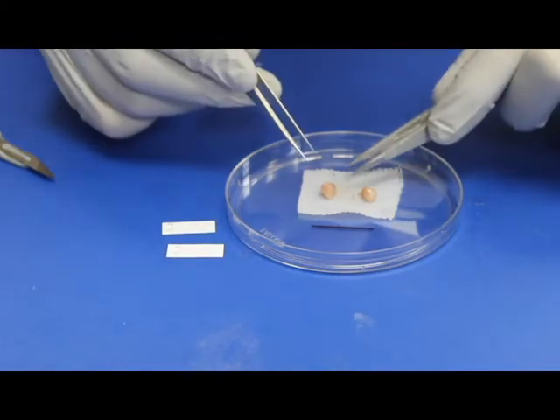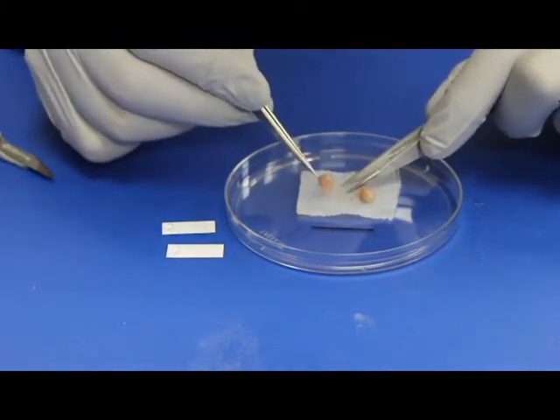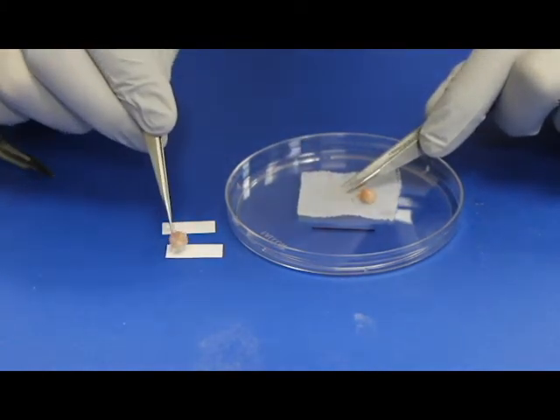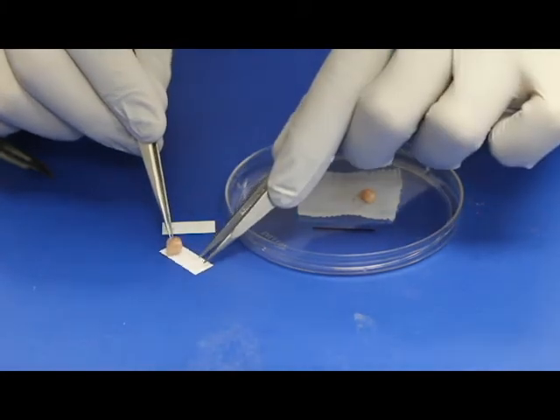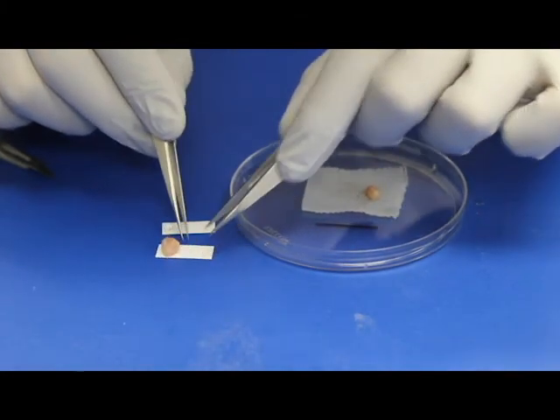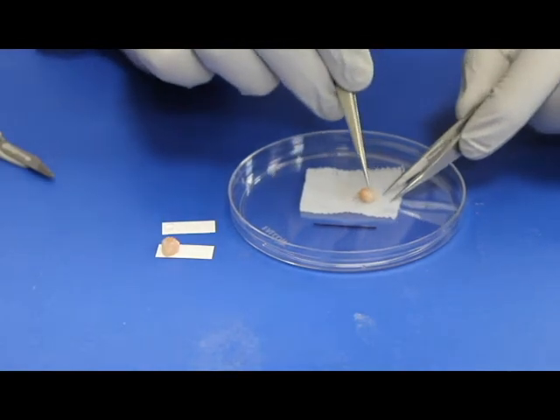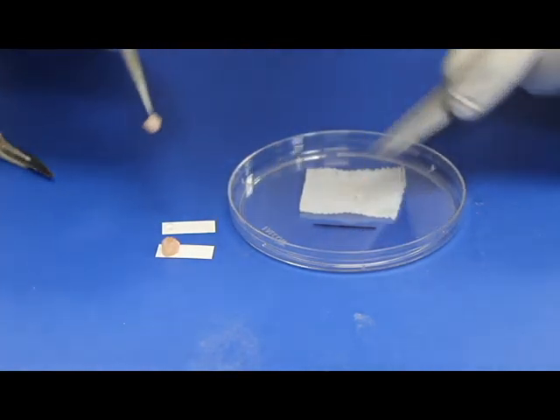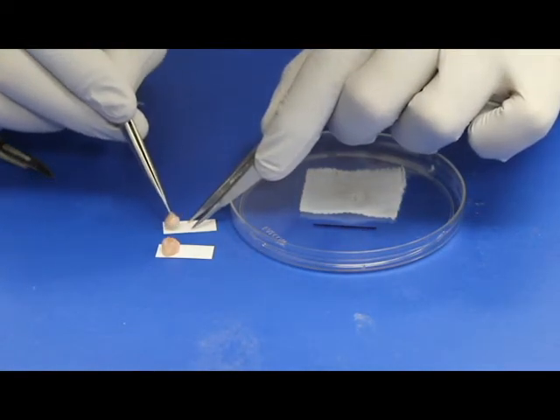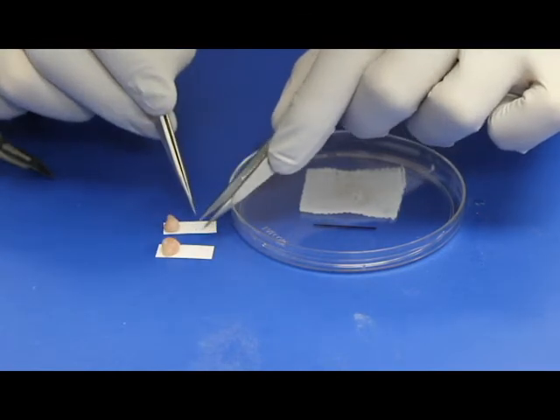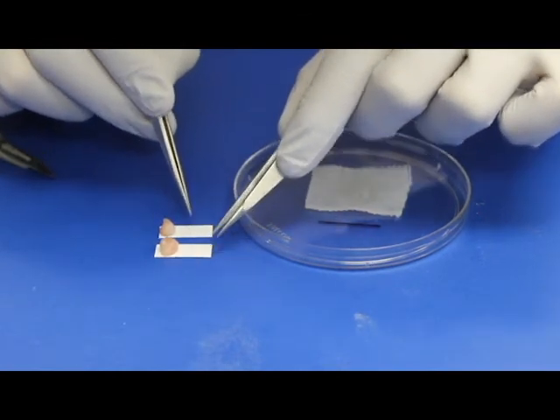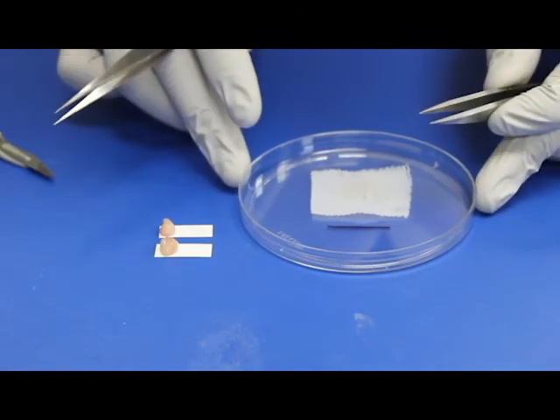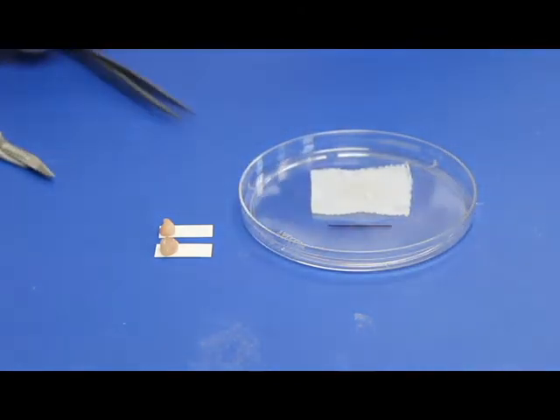Using your forceps, gently lift one piece and place it face down on the OCT on one index card. Do this with the second piece of muscle. Again, face down on the second index card in the OCT. As soon as the muscle biopsies are placed on the OCT, immediately proceed to freezing the samples in isopentane.